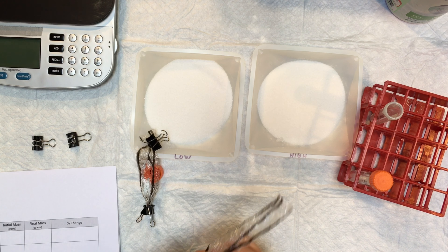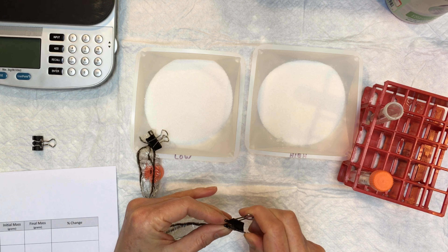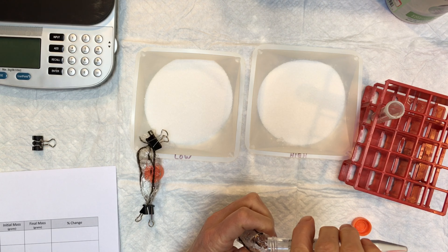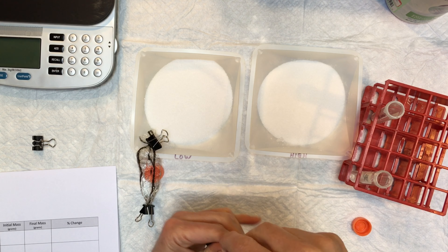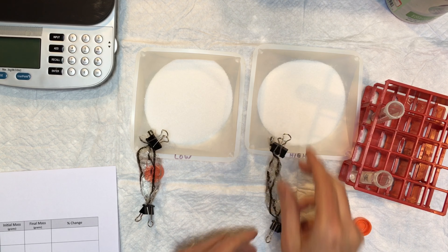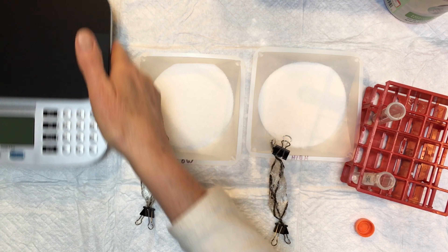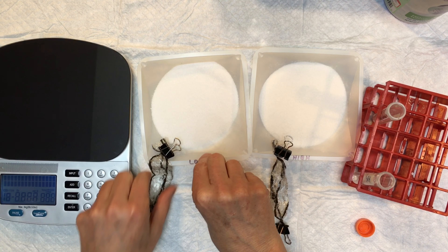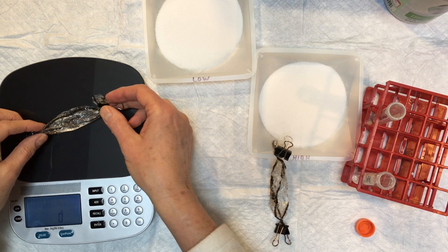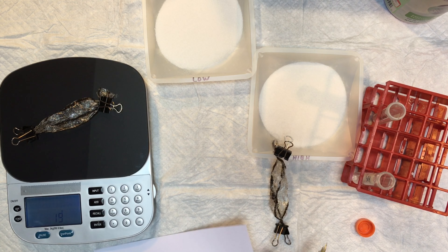I'm going to do the same thing with the high glycerol solution — clip it on there, fill it up, and clip it. We don't need to be very particular about the amounts because we're going to go by weight, not volume. The next thing is to bring our scale over here, turn it on, and get our low glycerol solution worm — it is weighing 19 grams.